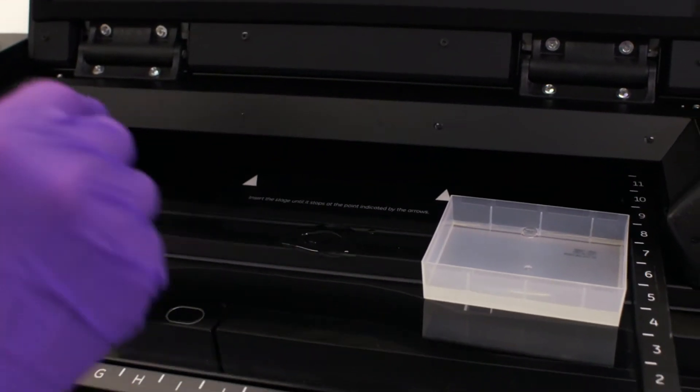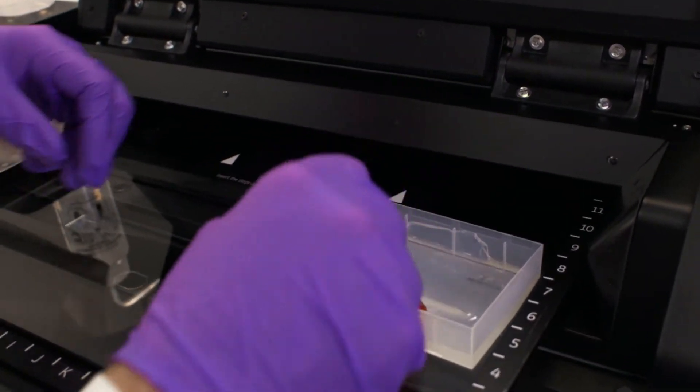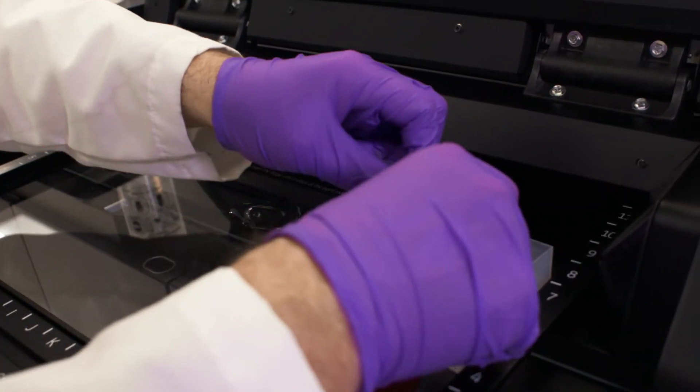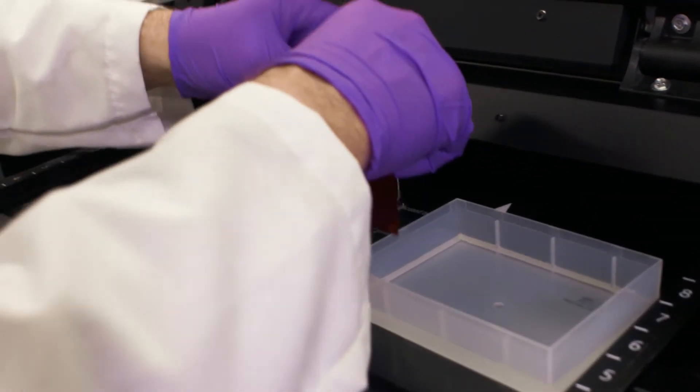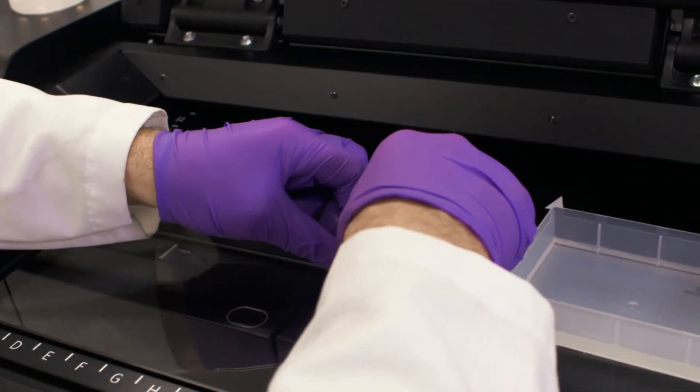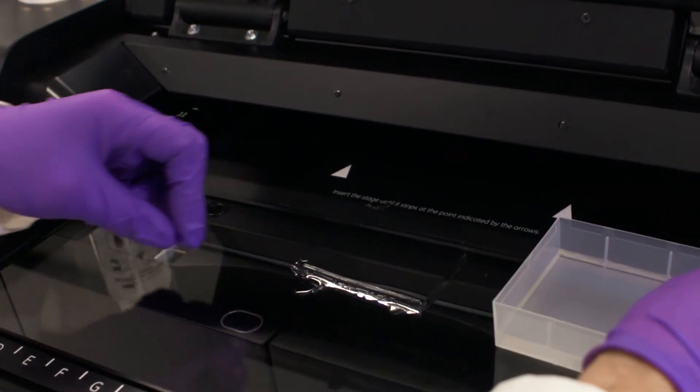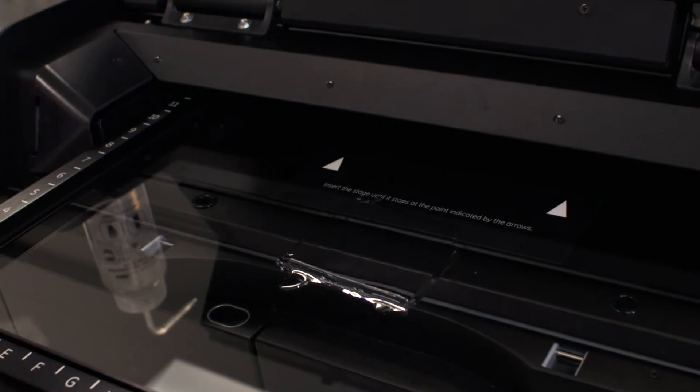We can assist ourselves using this device here. We'll get our gel and place that on top of the water patch. Don't forget to remove the container.